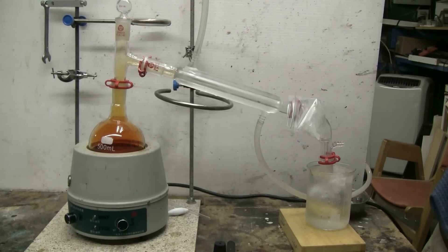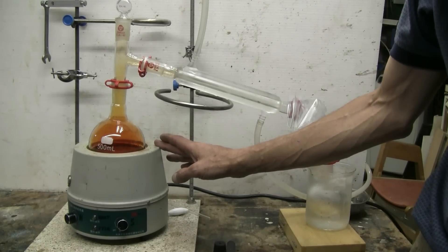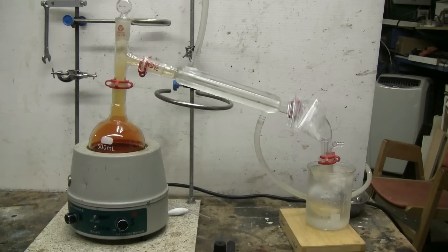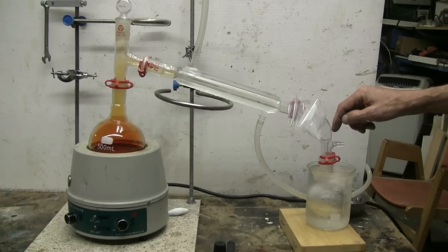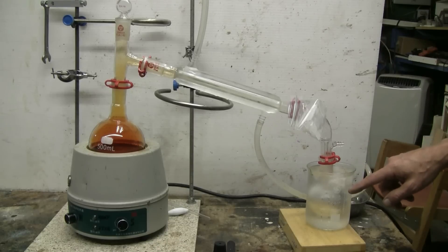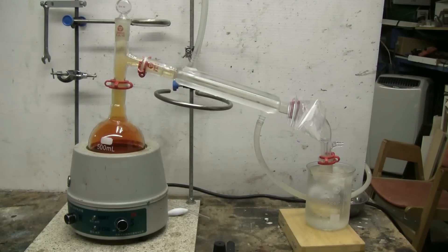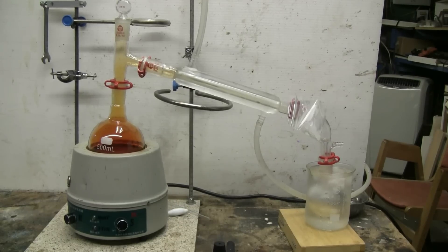I've set up for simple distillation to recover the bromine that I've made. The 500 milliliter round bottom flask is now in the heating mantle and heat is applied. Water is running through the condenser jacket. I've got plenty of ice packs in my 5 gallon water bucket, and I'm using a plastic bag with ice cubes at the end of the condenser. There's also a 100 milliliter round bottom flask in an ice bath - all of this to keep the bromine cold and keep it from turning to bromine gas.